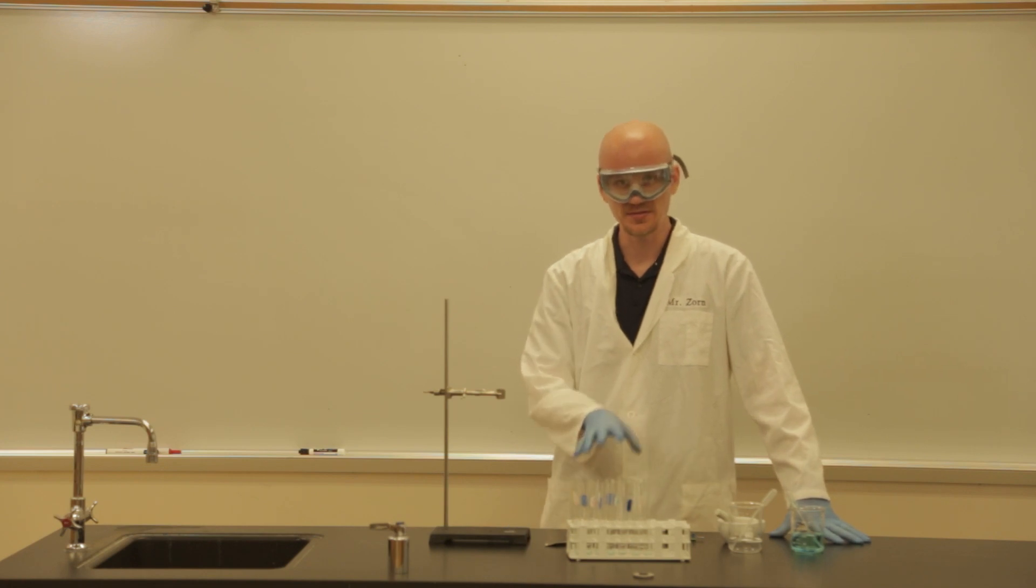Some of the samples in this lab are toxic, so please make sure that when you're all done, after you've cleaned up, you make sure that you wash your hands with soap and water. All right, let's get to it.